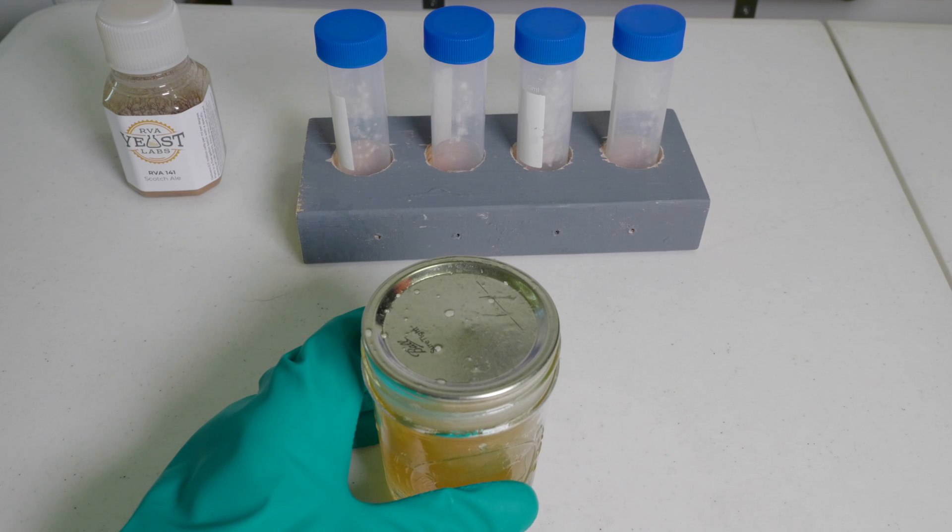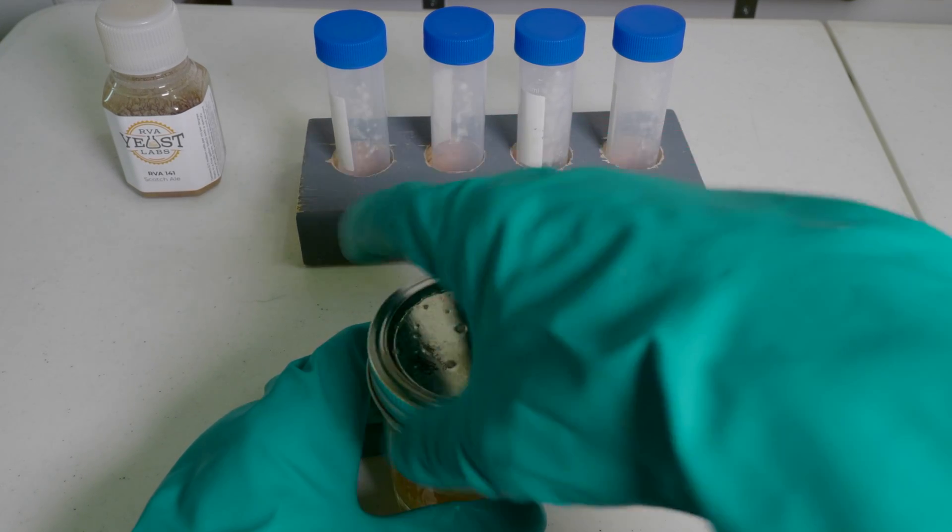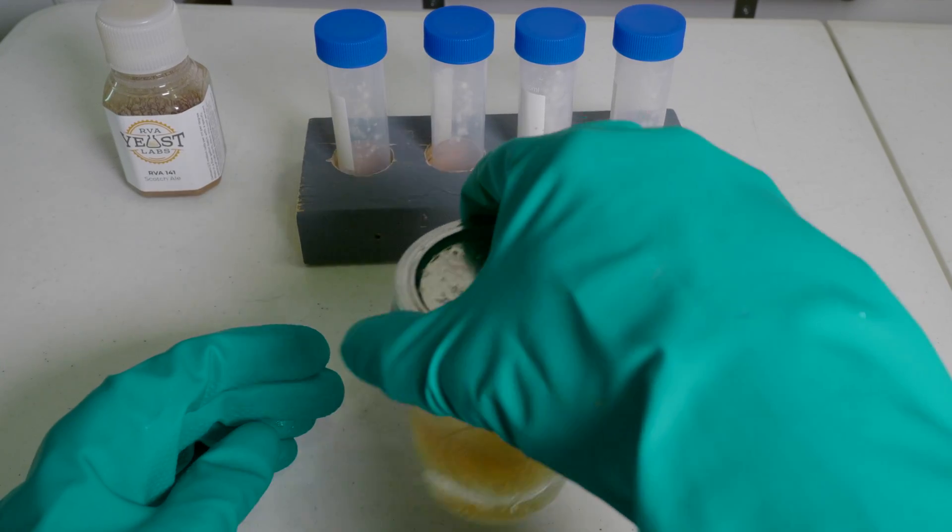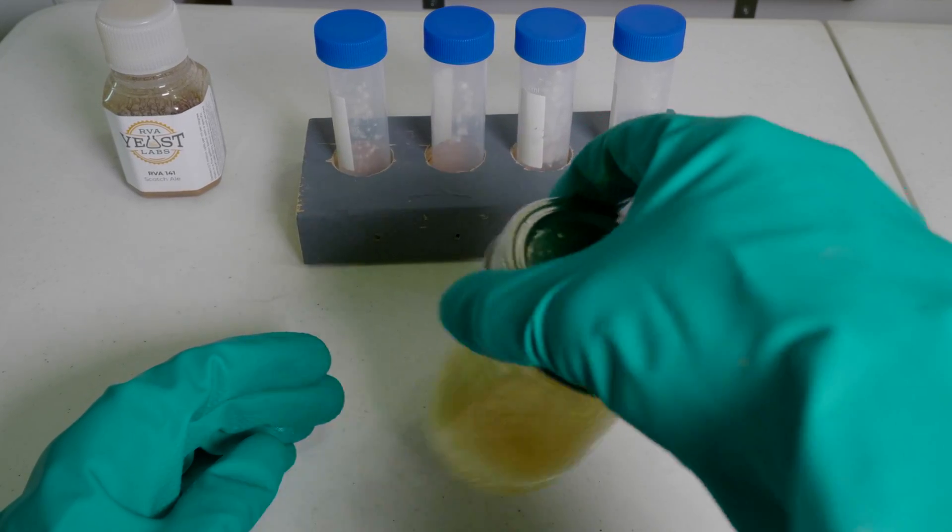I'm going to put the lid back on this and make sure it's mixed up really well. Glycerin is going to protect our yeast when we freeze it, so we're going to make sure it's really well dispersed with the wort.